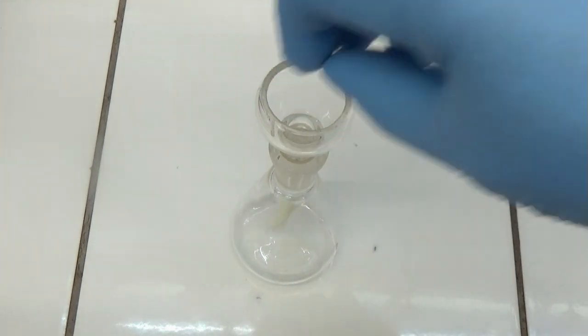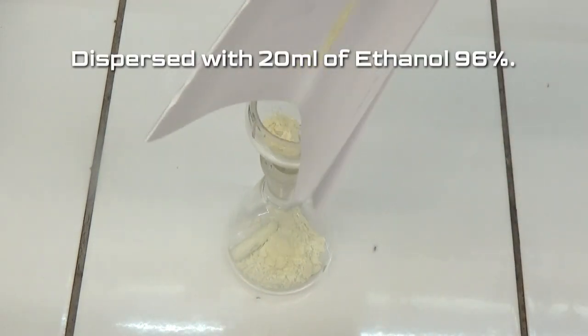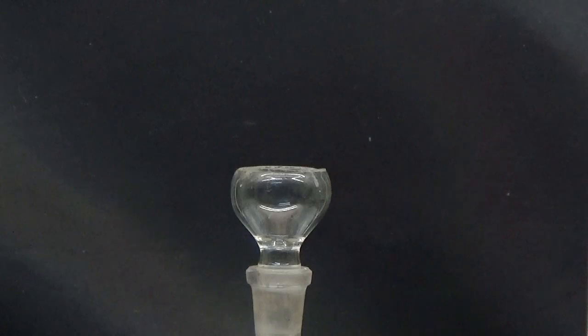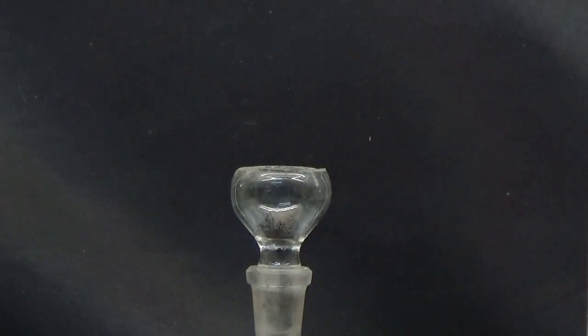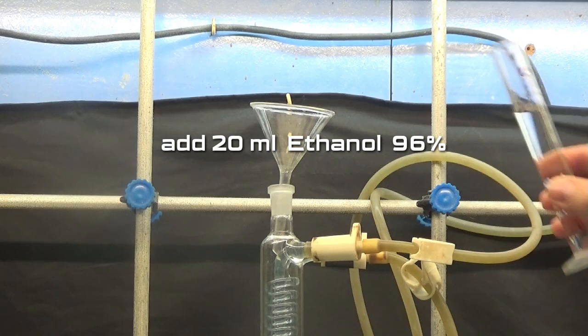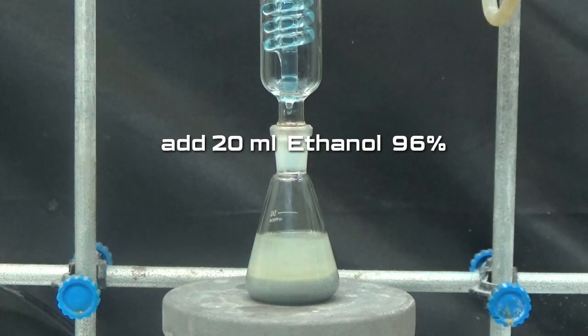To purify the product, it is put dry in a 100 ml flask and dispersed with 20 ml of 96% ethanol. Add a small amount of charcoal. After refluxing, add 20 ml more of 96% ethanol and heat at reflux for 1 hour.